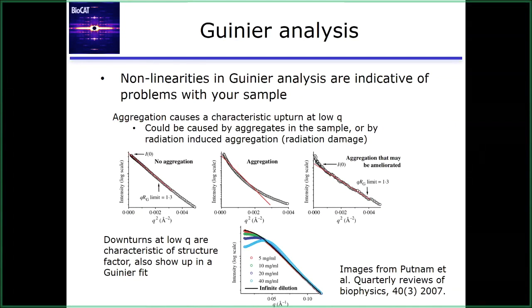So I'm showing 3 plots here in the center. There's on the left the one with no aggregate. It has a nice linear Guinier range. It fits very well. The next one, if you try to do a Guinier fit to this range, you can see there isn't a good fit. This is a lot of aggregation. This is like that curve I showed earlier. There's no linear portion of this curve that you can do a Guinier fit to. And if you try to do it, you'll see that immediately. This will tell you there's an issue with your sample.